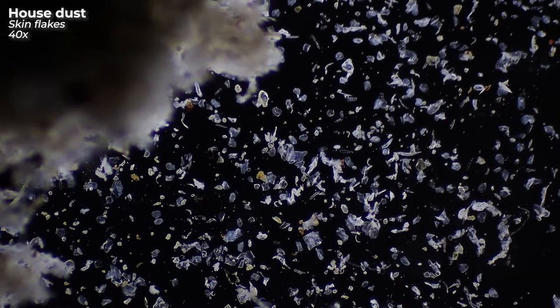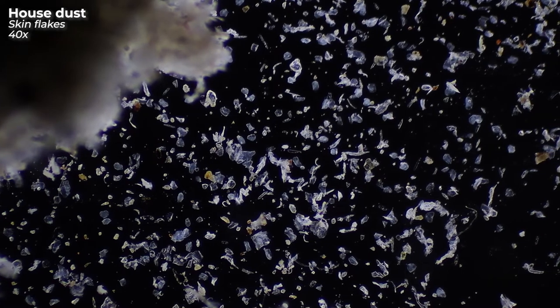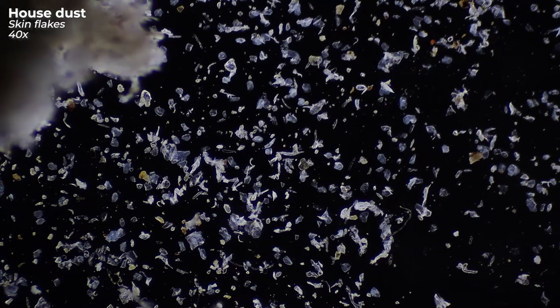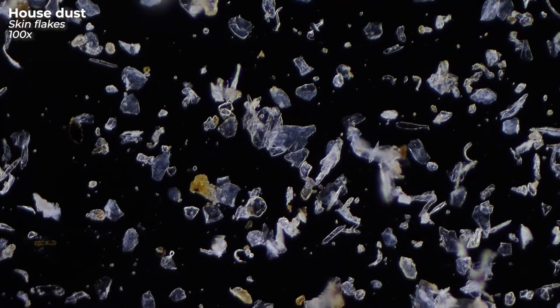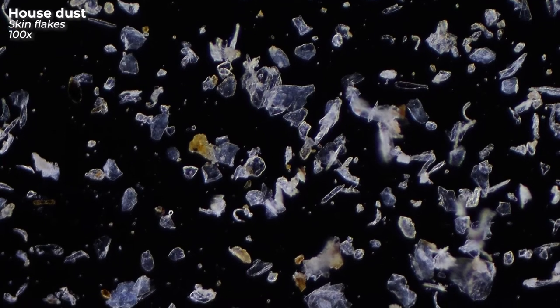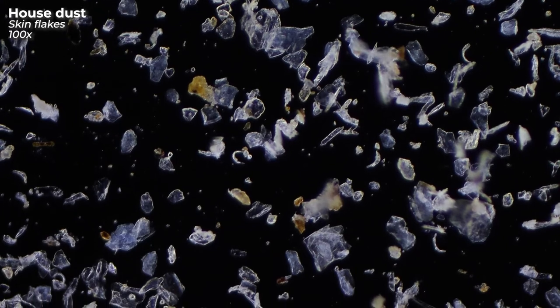Another component of dust are these tiny little flakes of skin that both we and our animals shed every day. On average we lose 30,000 to 40,000 skin cells per minute — and that is something that certain uninvited roommates are just waiting for.